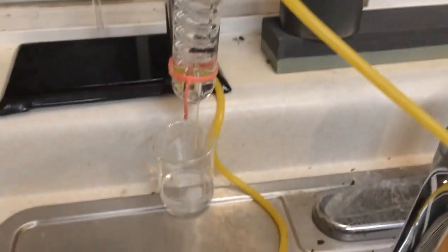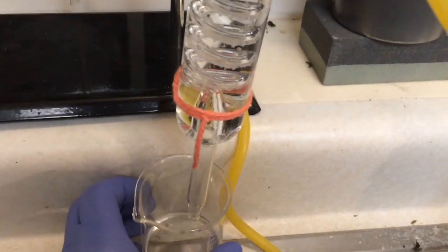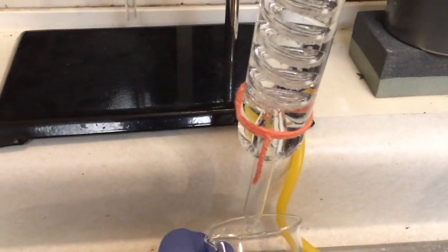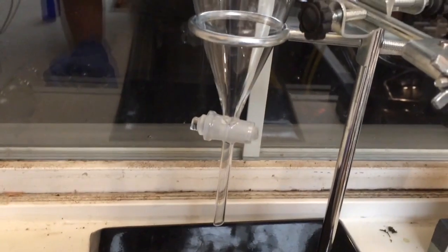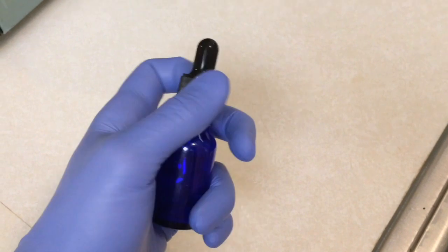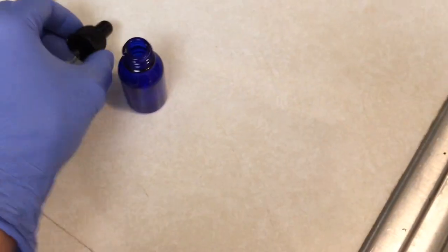I've got my spirit burner off. Now I'm just going to take this hydrosol that we collected. I'm going to put it in my separatory funnel. So before I do that, I'm going to put one of these collecting bottles, courtesy of Mi Madre, under there.